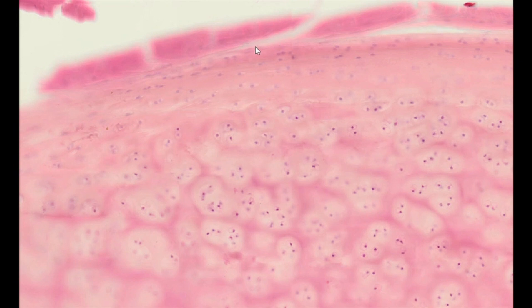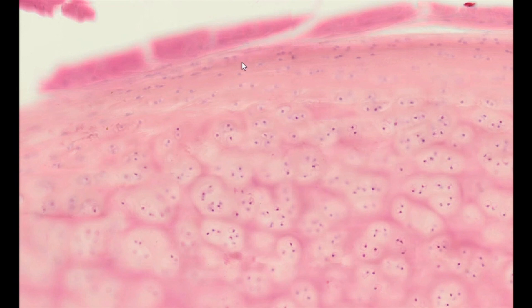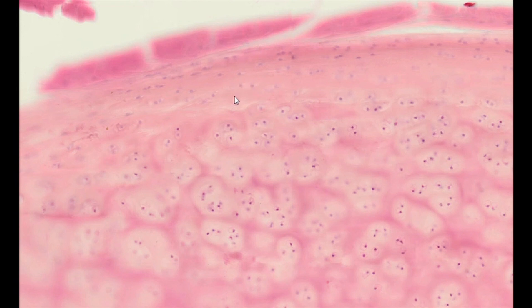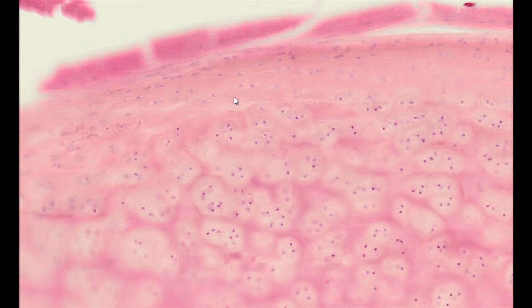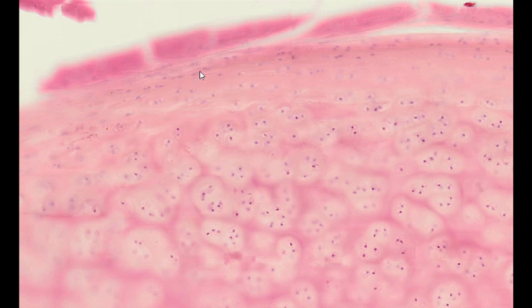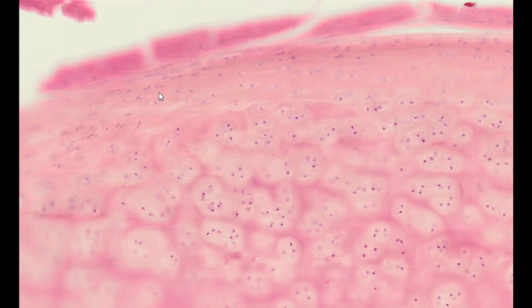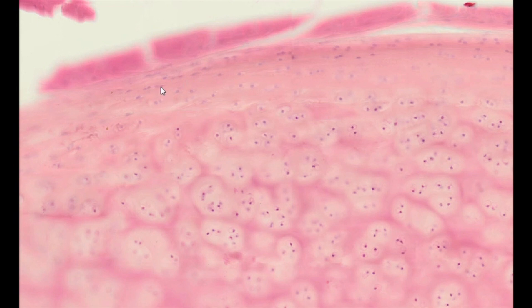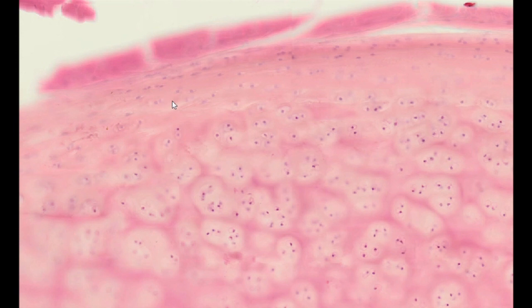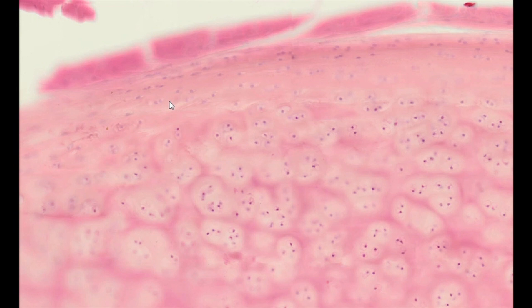The perichondrium layer laying on the inside, adjacent to the cartilage, is a cellular layer in which, in addition to fibroblasts, mainly flat chondrogenic cells are present. They constitute a pool of cartilage stem cells from which new cartilage chondroblasts are recruited. These cells divide and produce extracellular matrix components, which results in the deposition of new cartilage layers from the outside. This process is known as cartilage appositional growth.